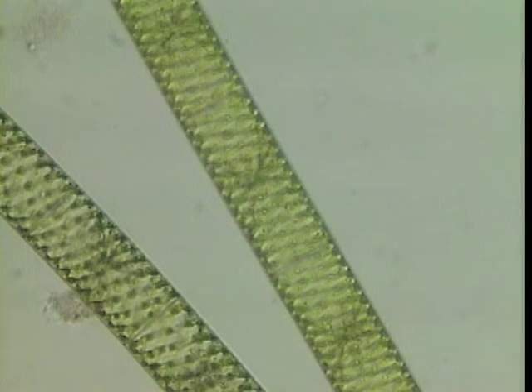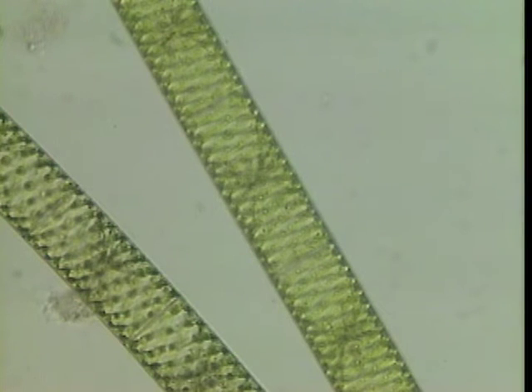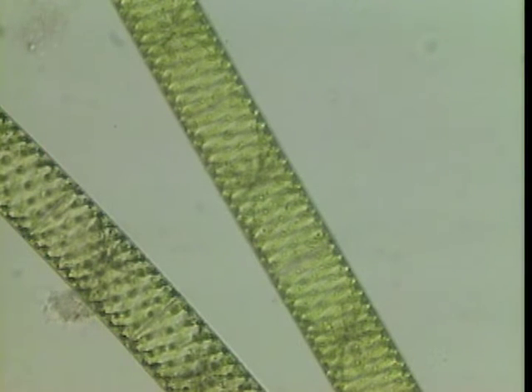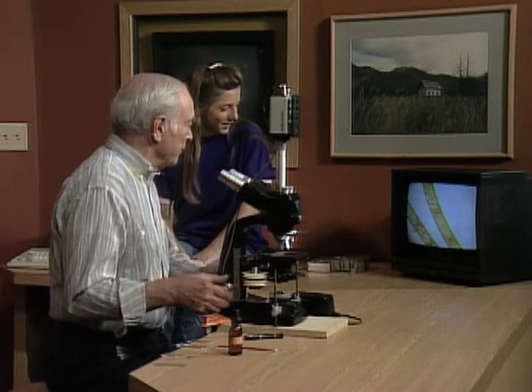Here's another superstar of the microscopic world known as Spirogyra. And obviously the color gives you an indication — is it a plant or an animal? It's a plant.